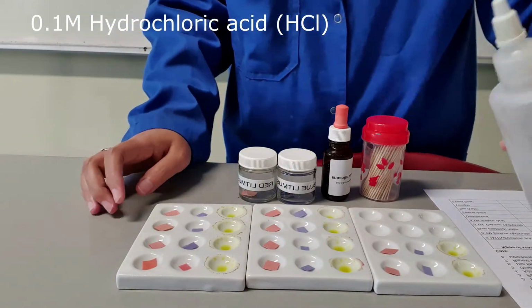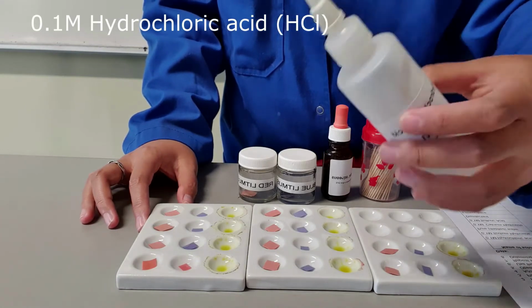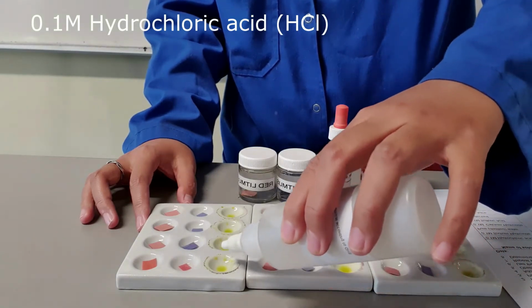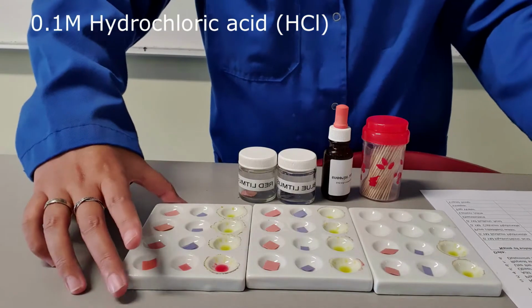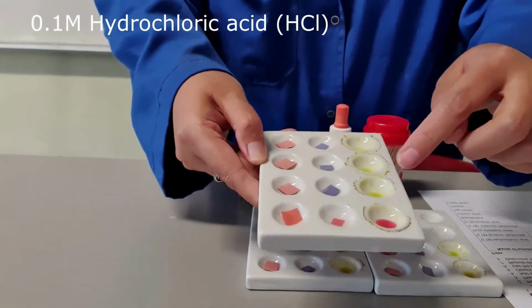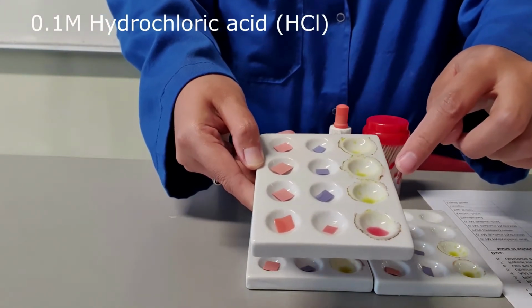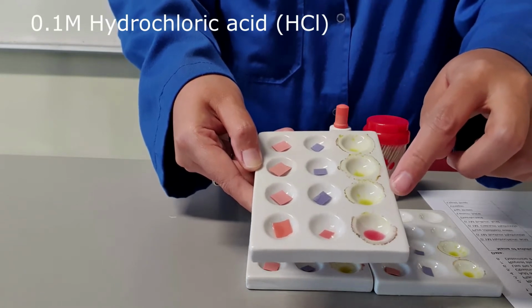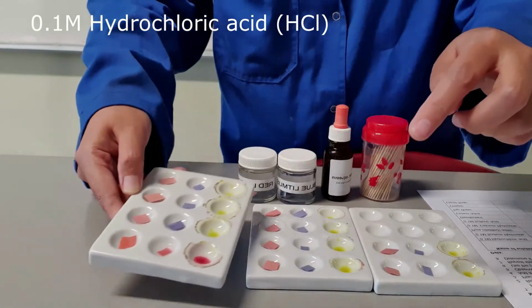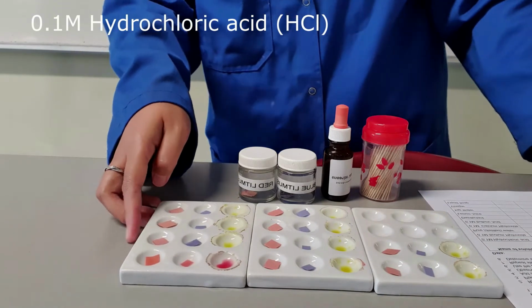Now the last test that we will be conducting is putting some hydrochloric acid into the universal indicator, and please notice the color difference. Okay, so that is the original color of the universal indicator. Once an acid is mixed here, it turned red. So now what you need to do is look at your pH chart, which is located in your worksheet.